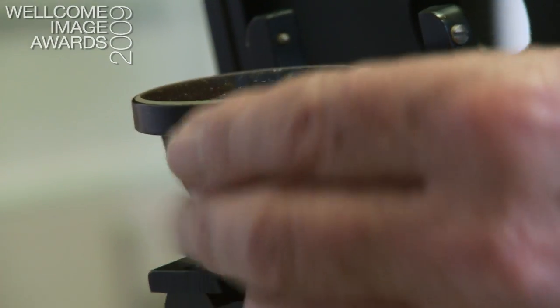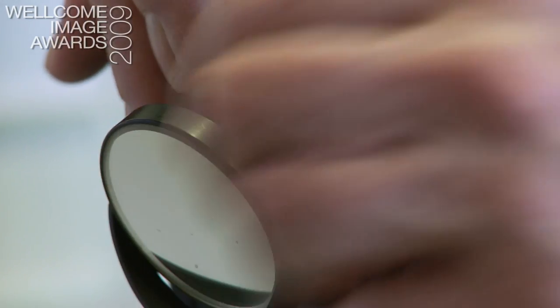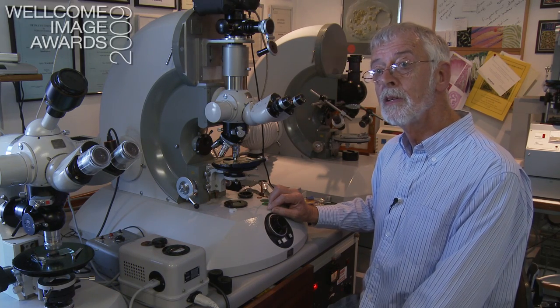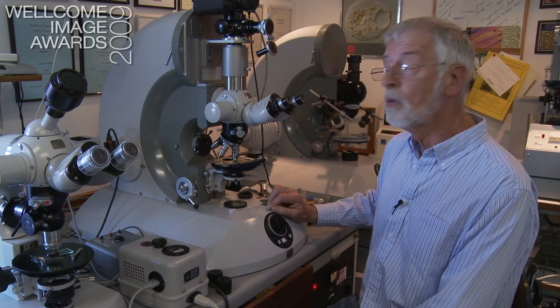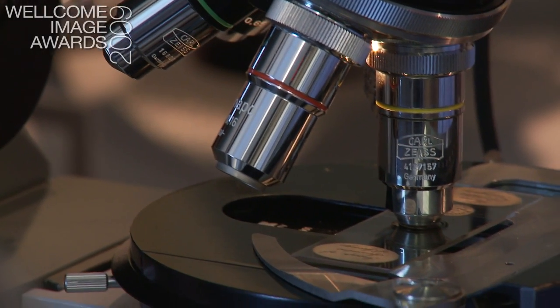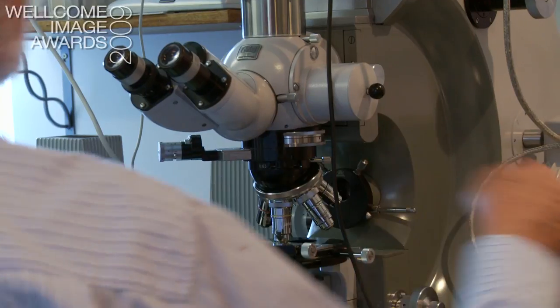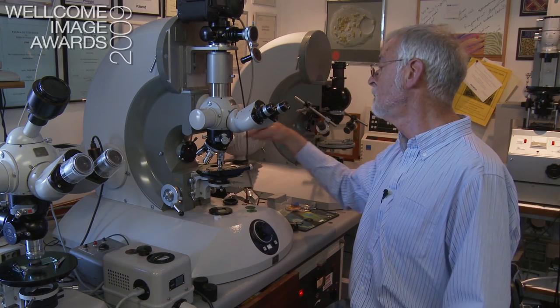Underneath that, because this was before microscopes had built-in light systems, it has a mirror, and so you'd have an external lamp. Here, certainly as far as size is concerned, we're at the other end of the scale. This is a microscope designed in the 1950s for serious research. The reason it's so large is that originally it had a plate camera in here and the light went off over mirrors. One of the big advances of this type is that you can not only look at transparent things with light going through, but you can have light coming through here and bounce it off the top of the specimens — so we can look at materials, silicon chips, metal specimens, and so on.